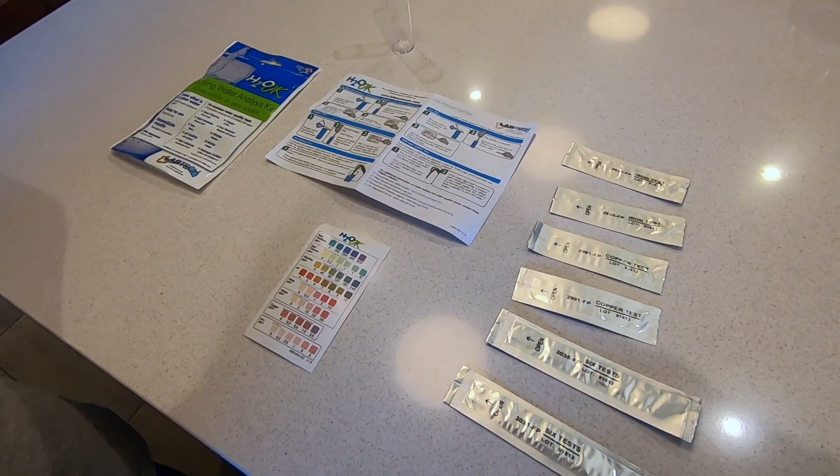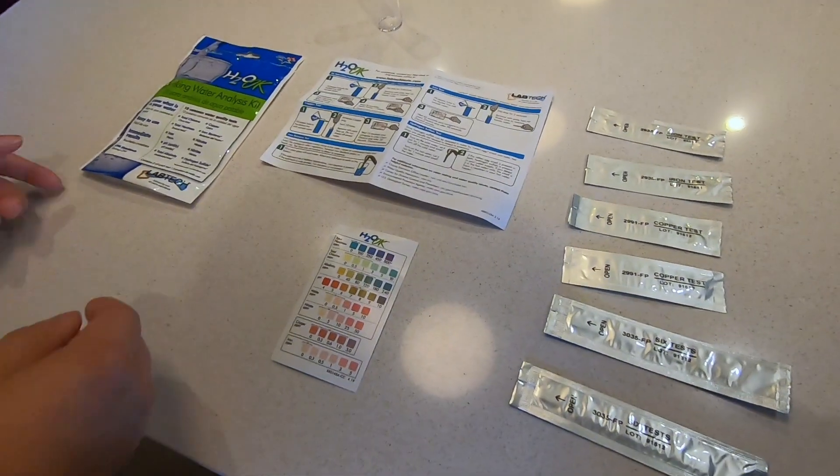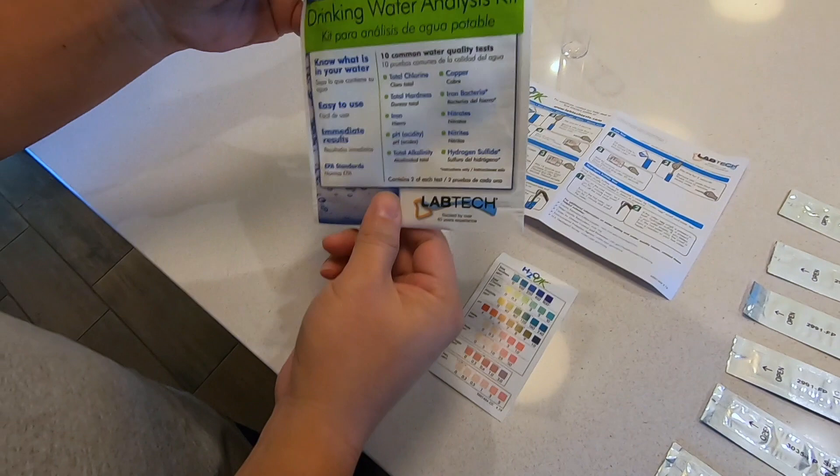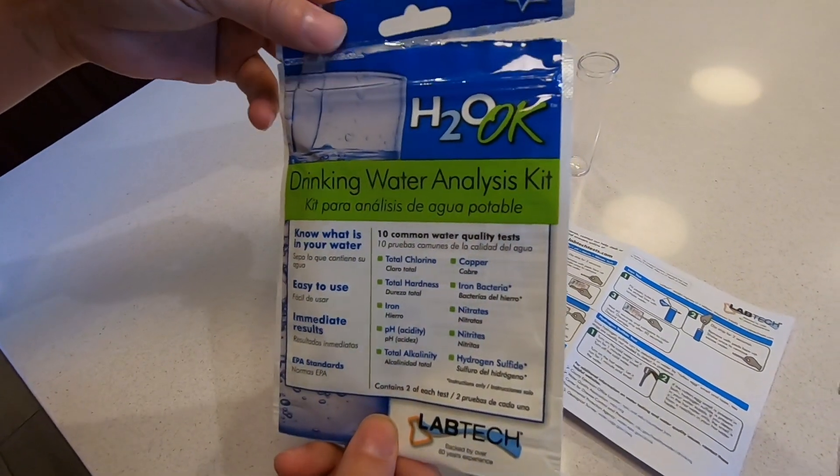Hi, in this video I am going to review and do some water tests for my house.